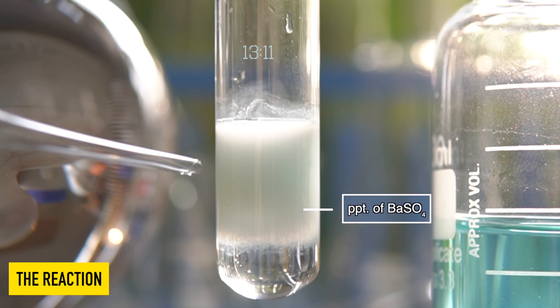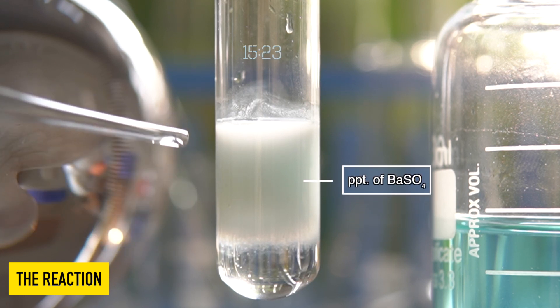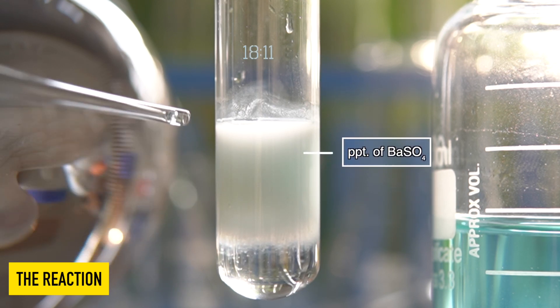The white insoluble PPT that has been formed inside the test tube is nothing but barium sulfate.